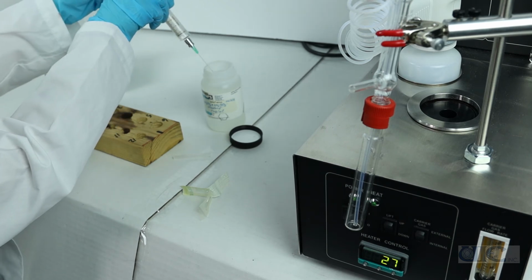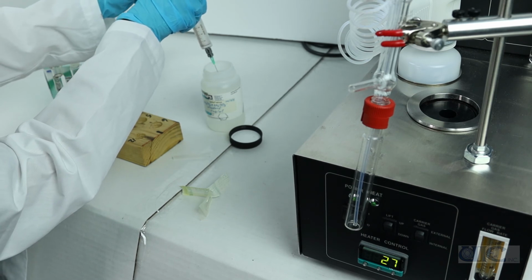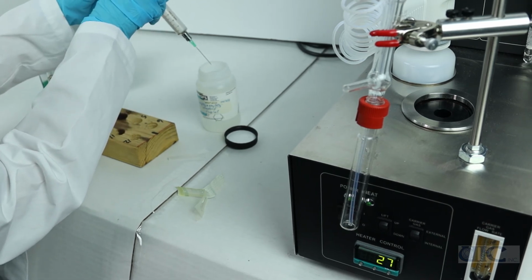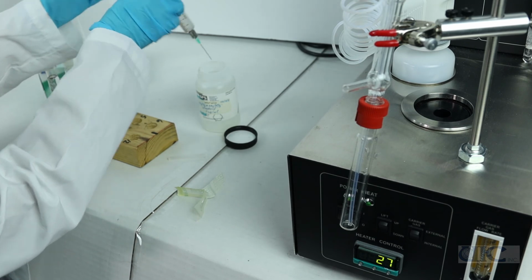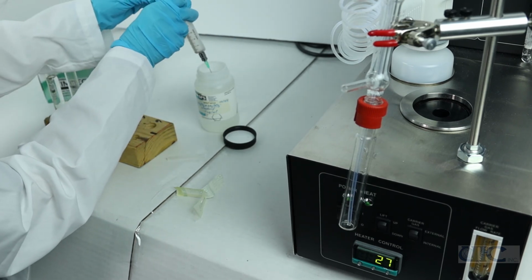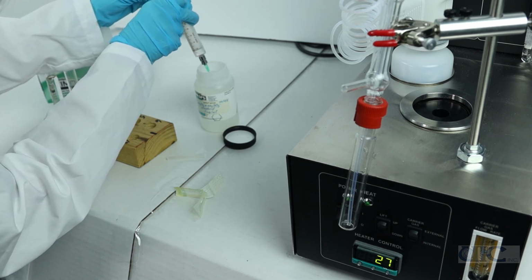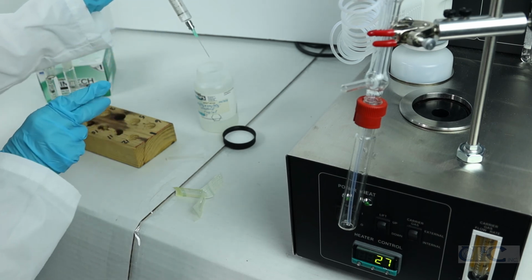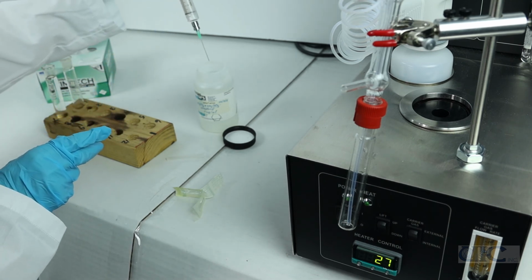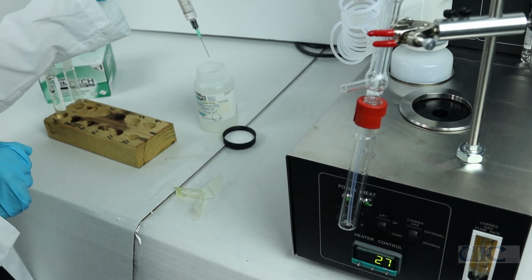Note on sample integrity. Because of the ability of amine solutions to absorb CO2, sample handling is extremely important. The collection should be done so that the sample has as little contact with the air as possible. Ideally, the sample should be collected into bottles with septum tops. The septum tops allow the sample to be drawn into the injection syringe without opening the sample bottle.